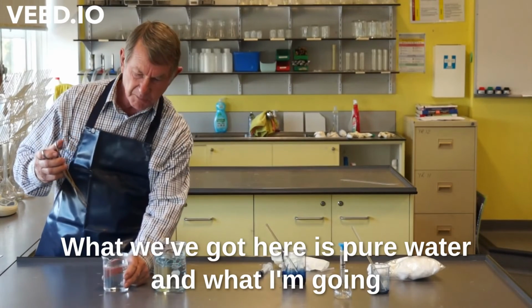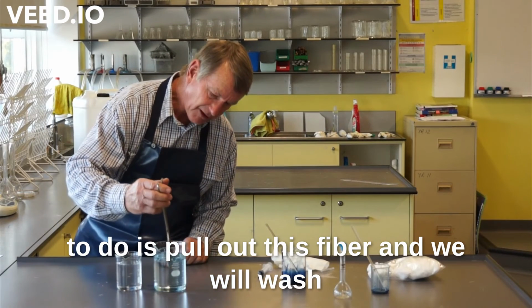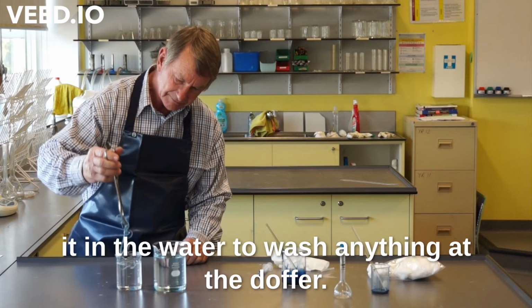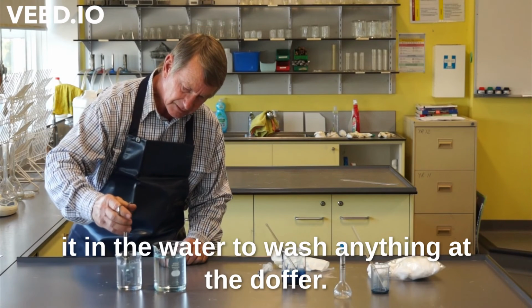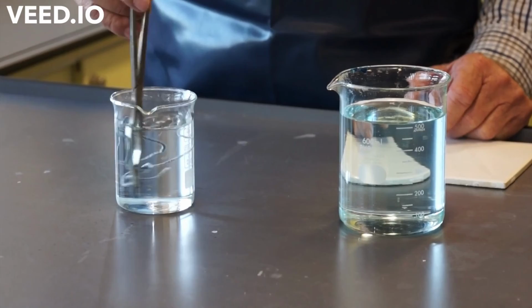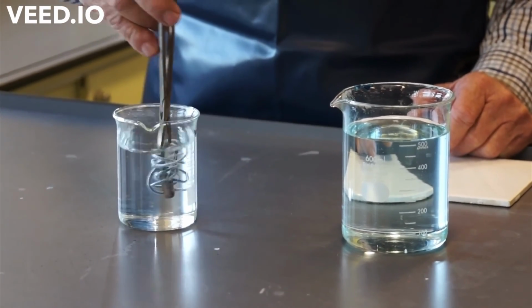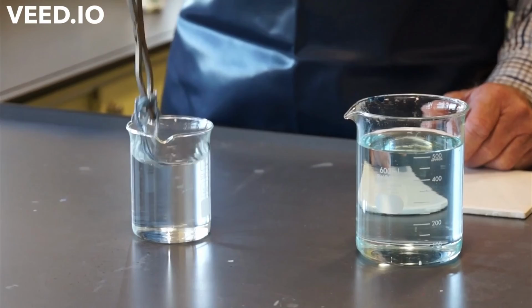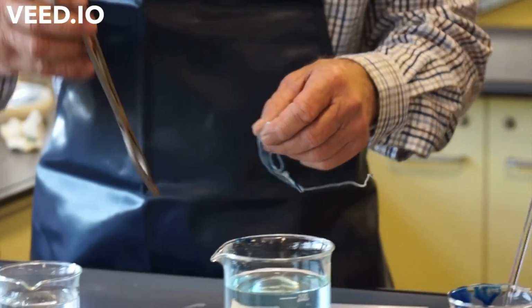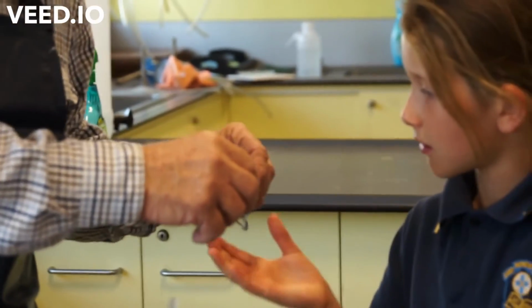What we've got here is pure water, and what I'm going to do is pull out this fibre and we will wash it in the water to wash any acid off it. There you go. There you get a little bit of rope.